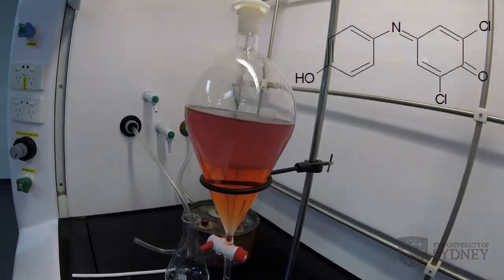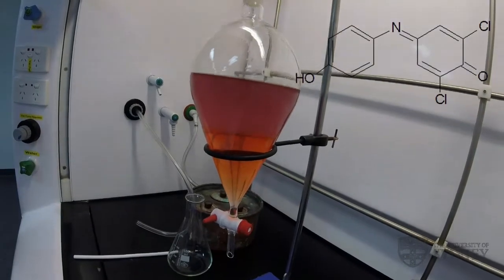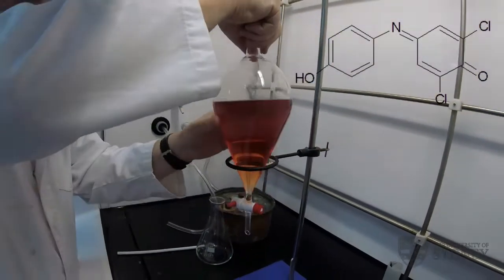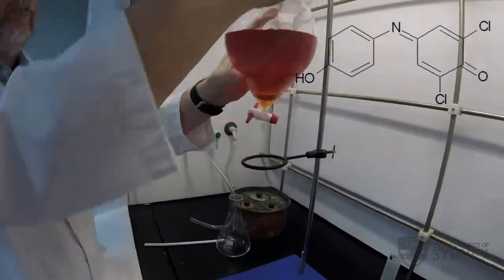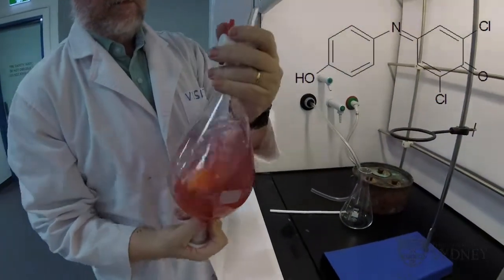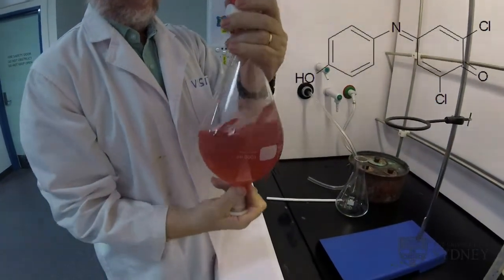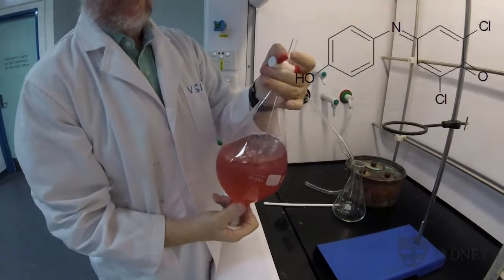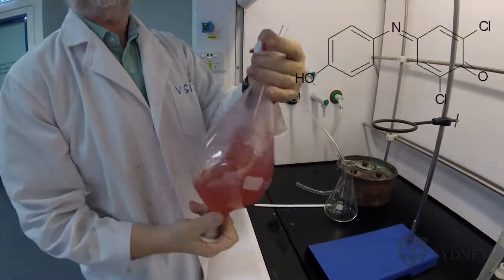That's started to extract. We'll have to be a little bit more vigorous with our shake. We'll have to be a little bit more vigorous with our editing too, probably.